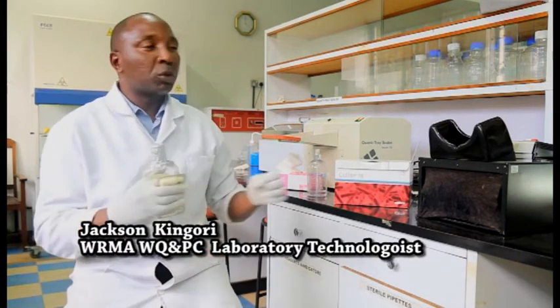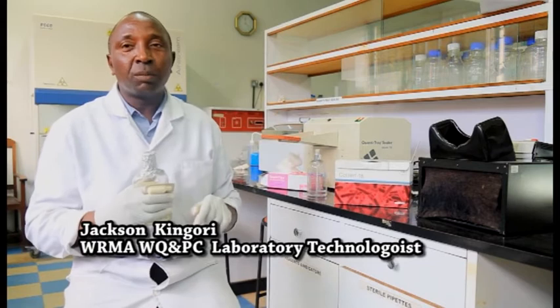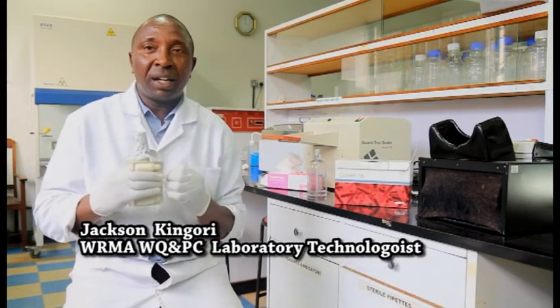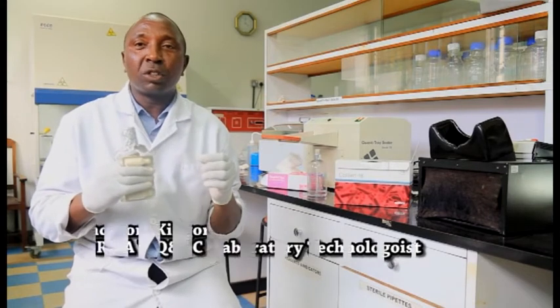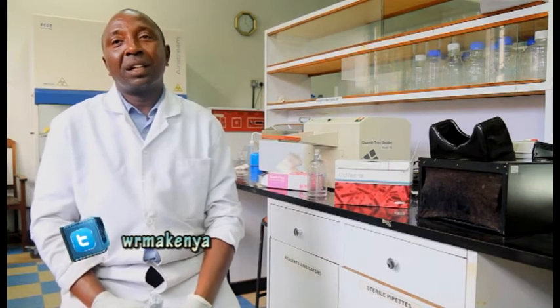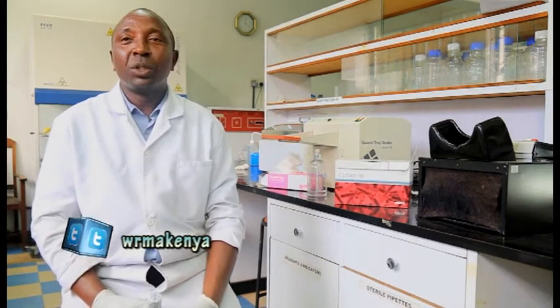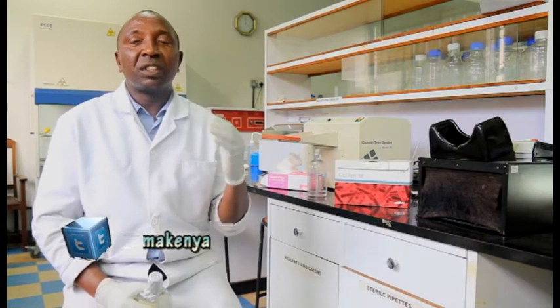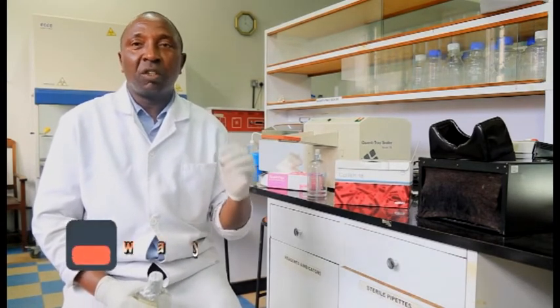And there you are able to go back to the interpretation table and get the concentration of E. coli in cells, that is cells per 100 ml. And by so doing, now you have the result, a complete report of the bacteriological quality of a sample of water.